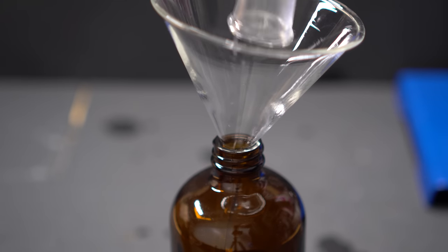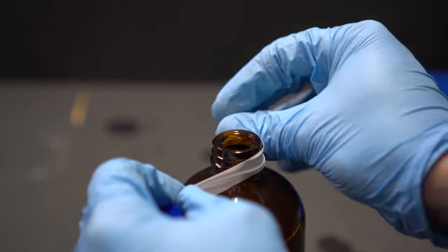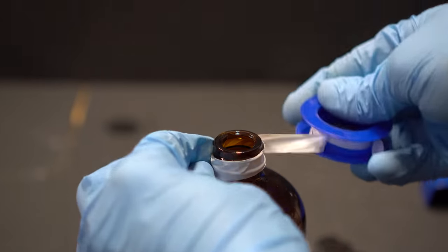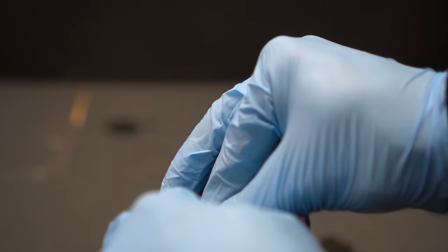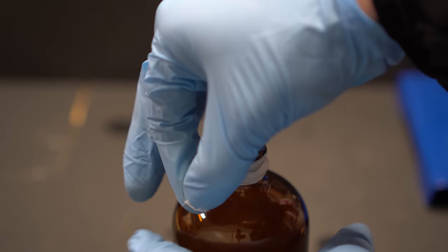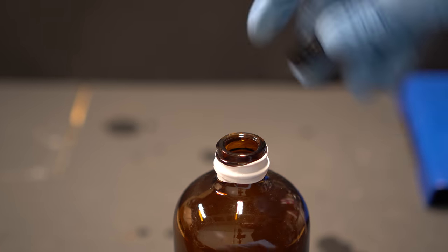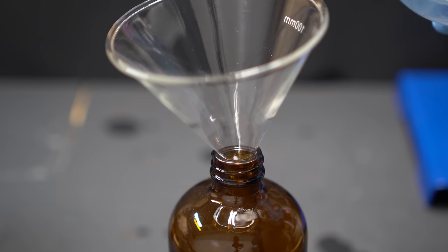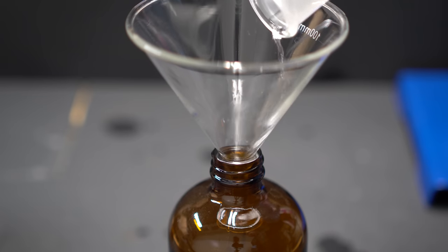As you've been seeing me pour this in, this is the ether. Ether is very important that you wrap in Teflon tape and make sure that it lids on tight. You're also going to want to store it over sodium metal or sodium hydroxide or potassium hydroxide.